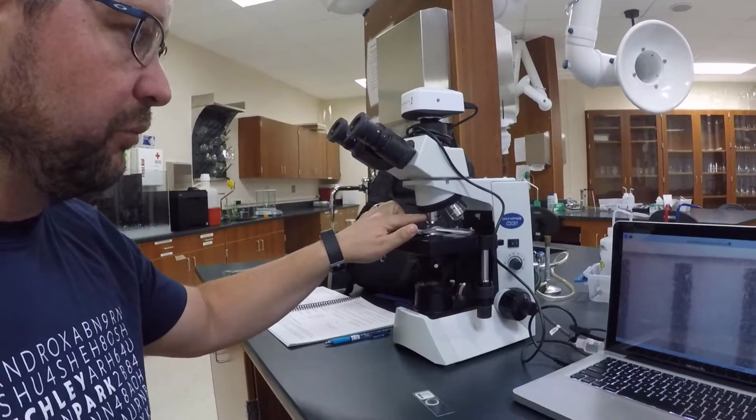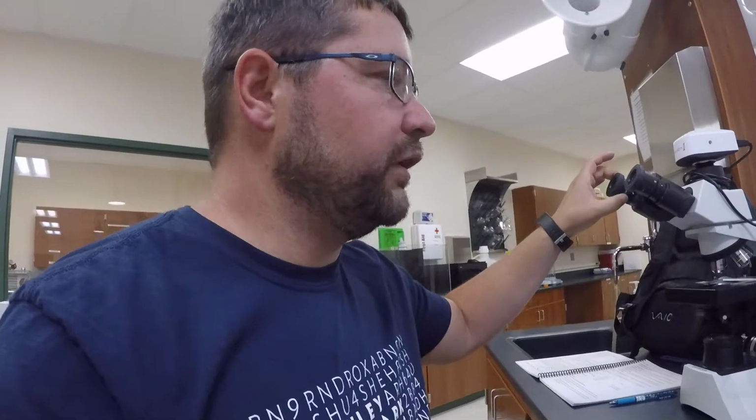Now that can be adjusted. You don't necessarily have to get a new microscope. You can change these objective lenses. So maybe you have a 2.5 times objective lens, or maybe you have a 15 times objective lens. You could also change the eyepieces. Instead of having 10x eyepieces, you could do 2.5 or 5x eyepieces. So there are ways to manipulate the magnification in a compound light microscope.